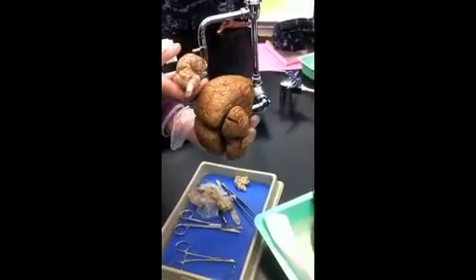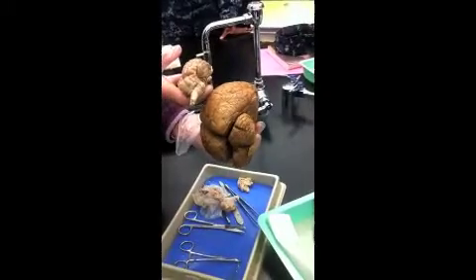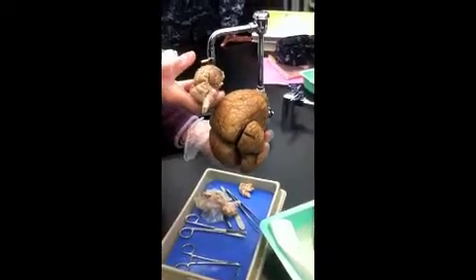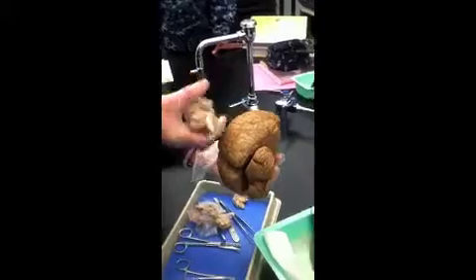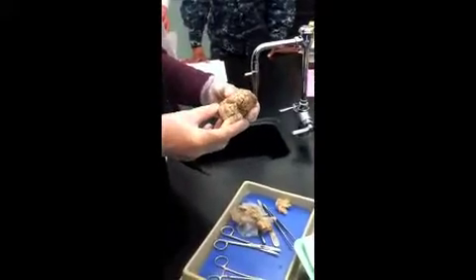The cerebrum compared to the cerebellum is much larger in the human than the sheep, for obvious reasons. You can't see a sheep stand on one foot, or do calculus, or play the piano.